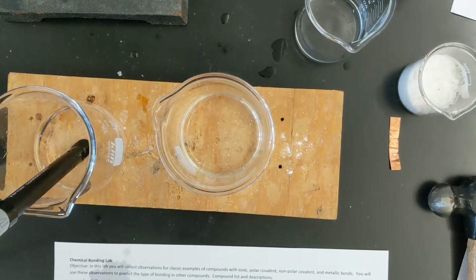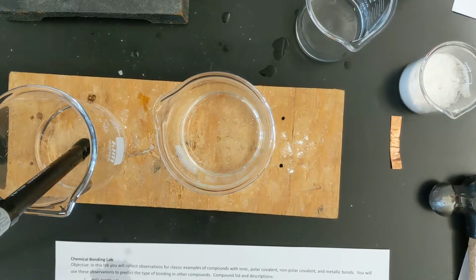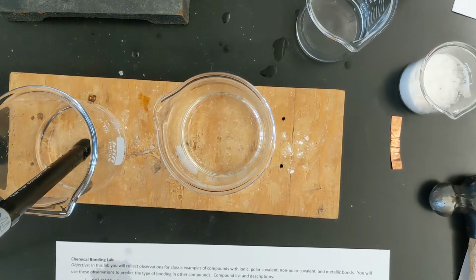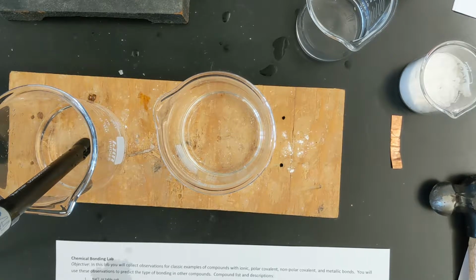So that's all of the tests we need to do for our alcohol. Again, you'll plot out the place on the bonding triangle. And you should see, once you plot this out, go ahead and write this down, that alcohol is a polar covalent bond. We want to look at the carbon-oxygen bond. That's where the polarity comes from in this molecule. So go ahead and write polar covalent for that carbon-oxygen bond.